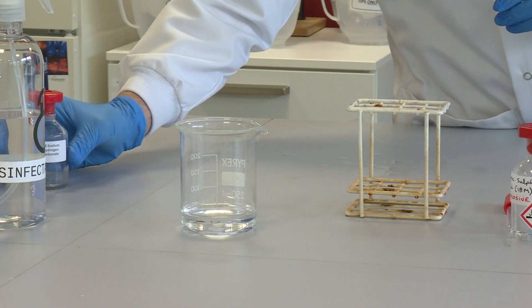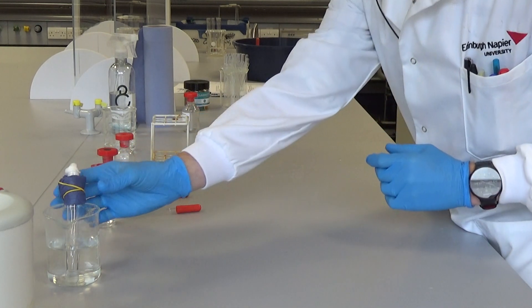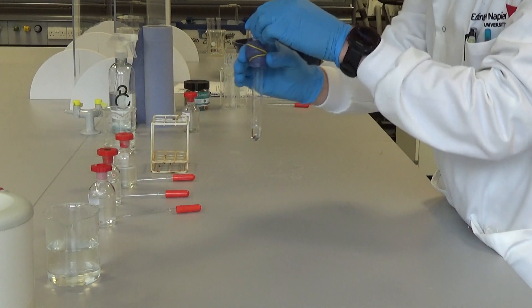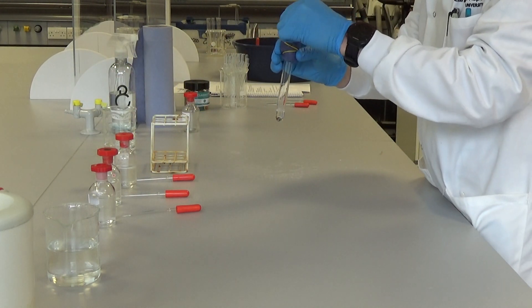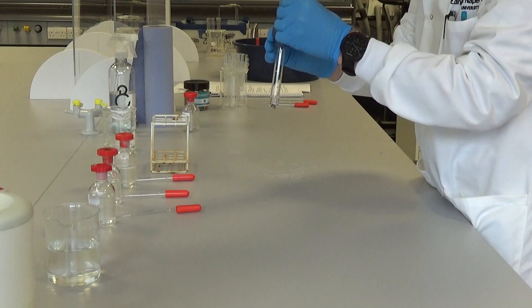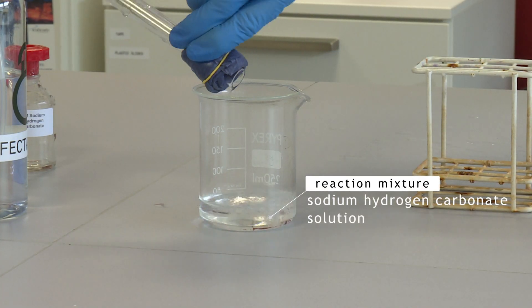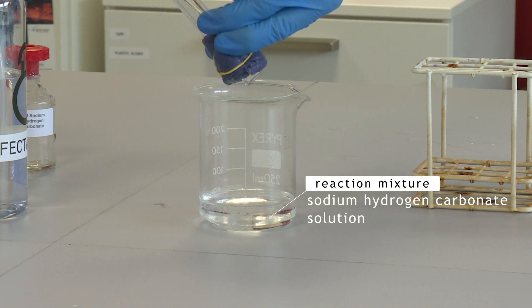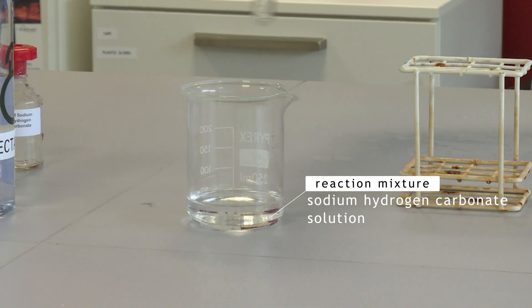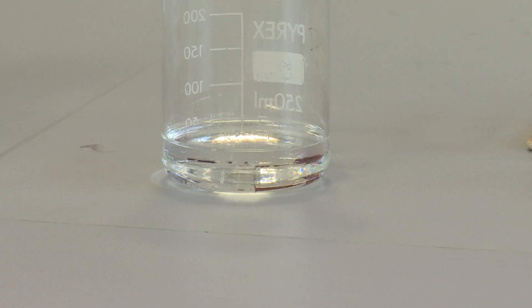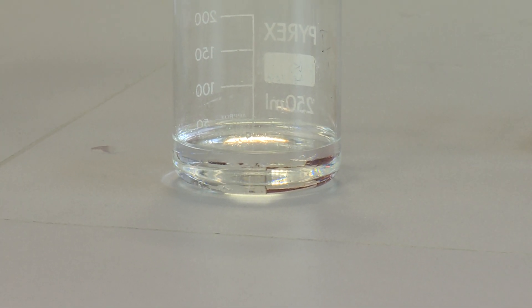When I add in the reaction mixture, that is going to do two things. It's going to neutralize the sulfuric acid catalyst and any unreacted carboxylic acid, and it will also remove the scent of the carboxylic acid. If I pour that in there, we should see it reacting and neutralizing. You see the fizzing there of it neutralizing. That will allow us to see two pieces of evidence of ester formation.